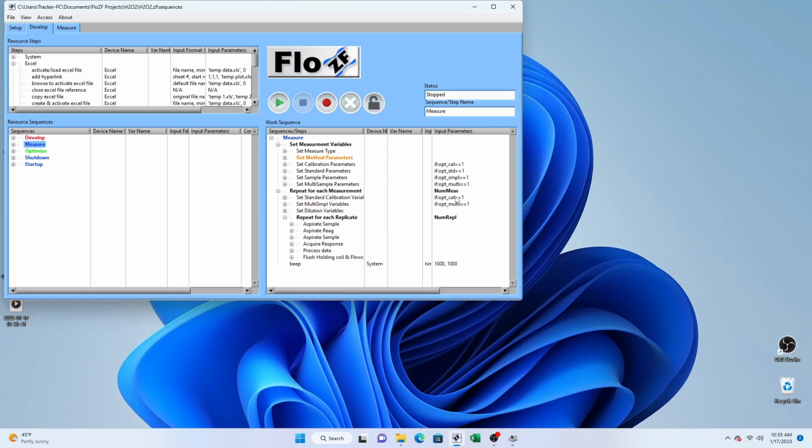Then for each measurement, for the number of measurement times, we're going to execute this sequence here, which will set up certain calibration variables. So if we're doing a calibration, we want to know what volume, or which standard we are going to actually be measuring, what the concentration is of that standard, and therefore what dilution factor we are going to have to carry out in order to get that dilution. We give the sample a name. For the multi-sampler variables, we're going to give the sample a name and prime the sample before we do the measurement. In the dilutions variable subsequence, we calculate what the volume of analyte and volume of diluent is, and then we use all of those variables to now repeat each replicate of the measurements.